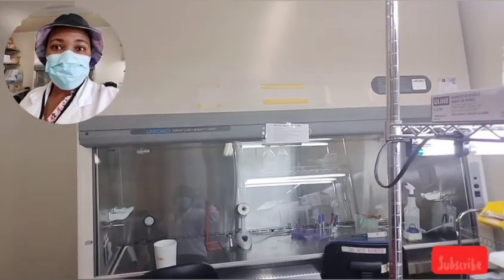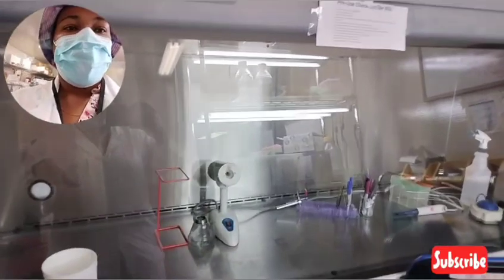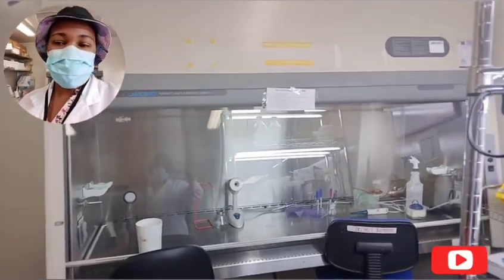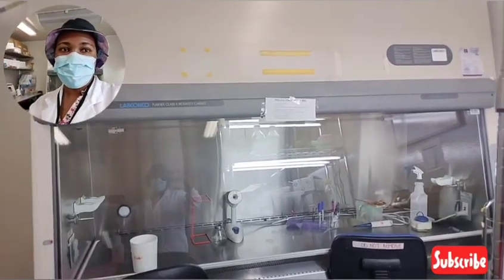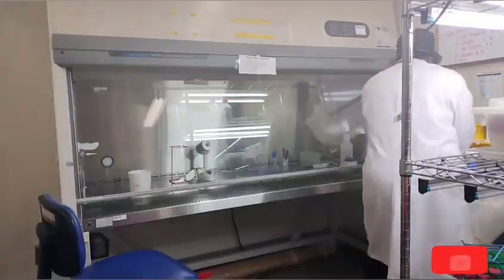So what I'm going to do now is clear it and prepare it so it will be sterilized using 70% ethanol, and then I'll just do a secondary UV, get it going so that when I need to work in there it's clean. So let's do that.